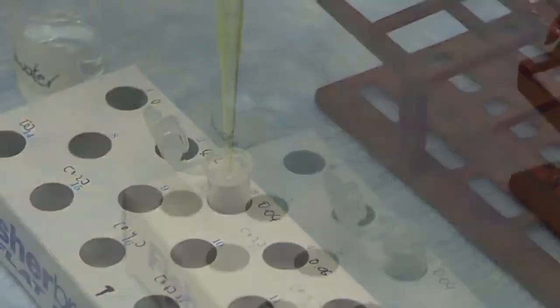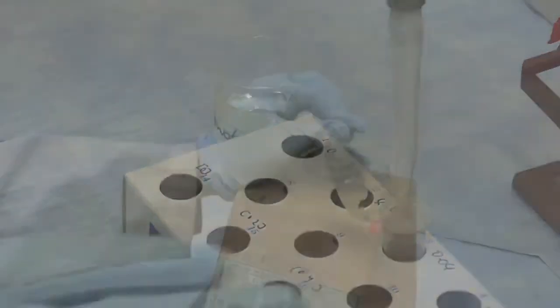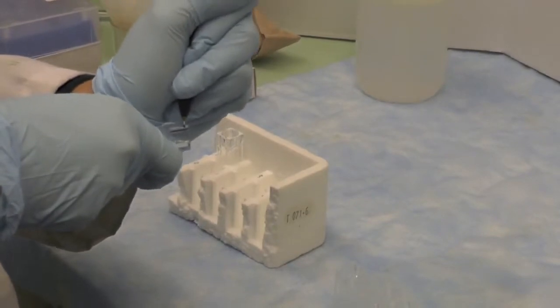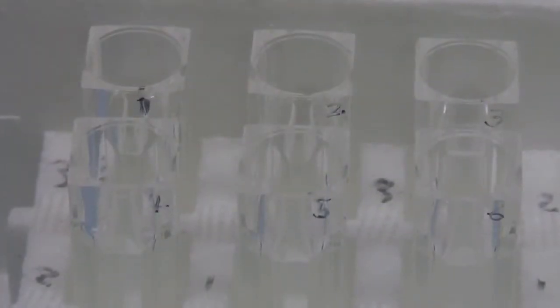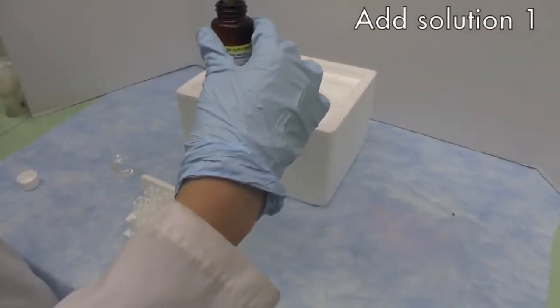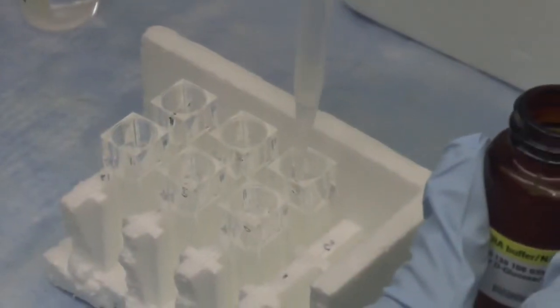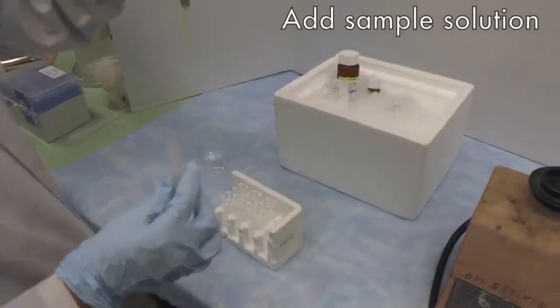Prepare enough volume for the enzymatic assay. Follow the enzymatic assay guide in your lab manual to add the appropriate volume of solution 1, sample solution and DD water into the plastic cuvette. Remember to use only half of the volume.